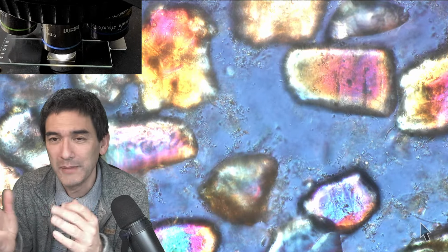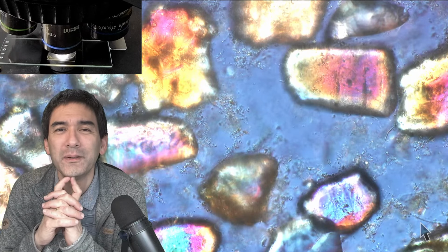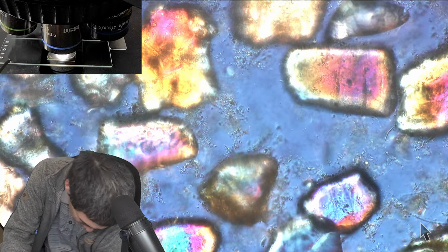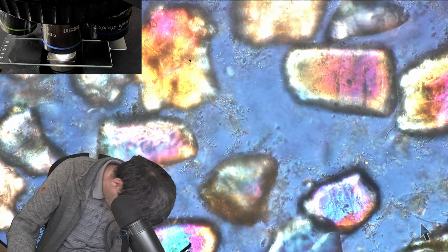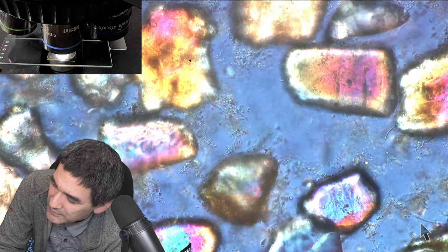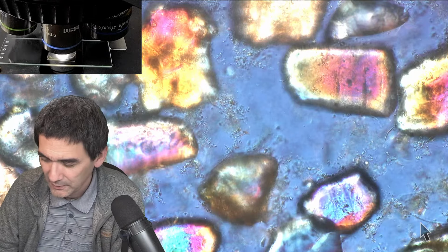But I tried that. Maybe we can optimize this, should I try that? Maybe. You know what? We tried out... I can show you something. Good. Actually, this might work. Just a second. I found something in here. I'm going to try a different microscope for that, not with this one over here because of the lack of space on the stage. But look what I have here. Actually, this is a good idea, but I need some interesting microorganisms. Okay, look, the desk view again.